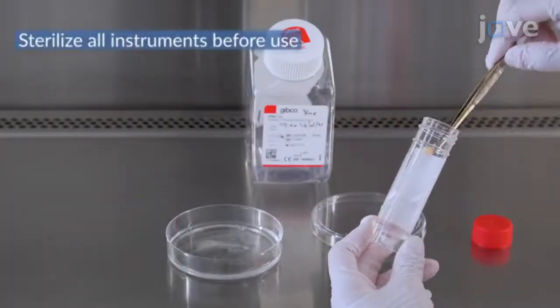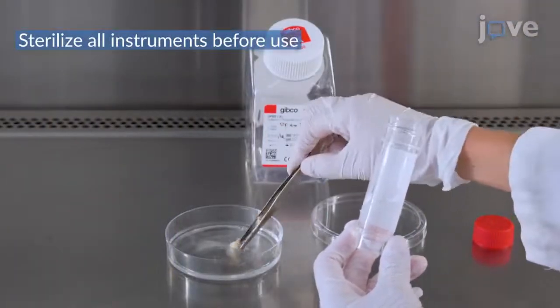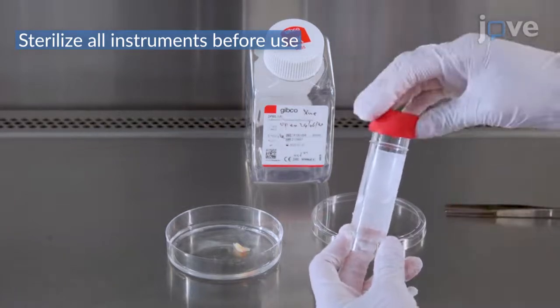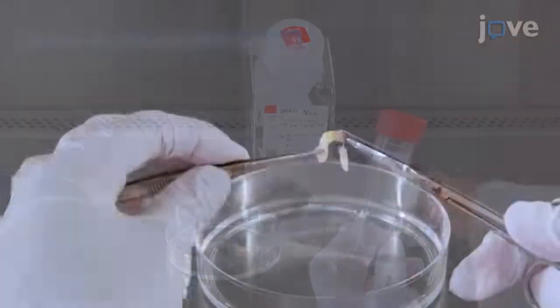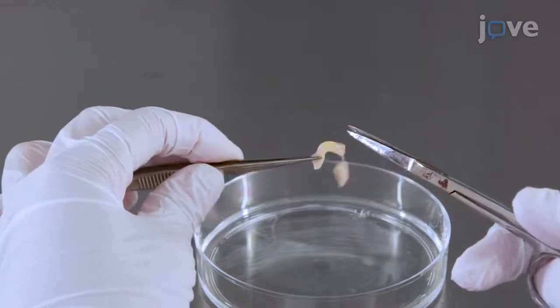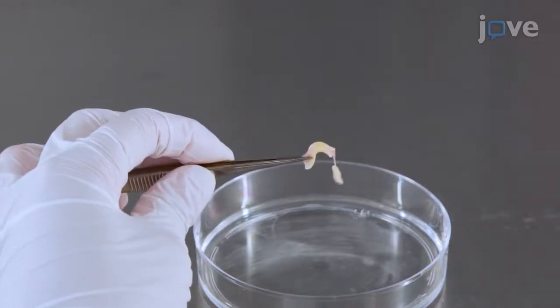At the end of the incubation, use sterile forceps and a laminar flow cabinet under sterile conditions to transfer the tissue into a petri dish of PBS. If the tissue is still in a ring, cut the artery open with scissors, taking care not to touch the innermost layer of the vessel, as the endothelium is easily damaged and removed.